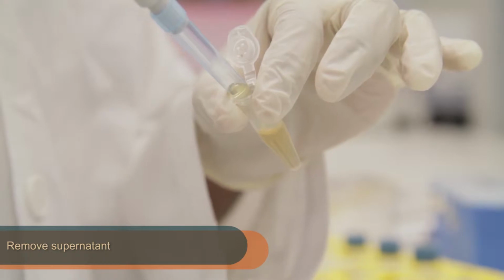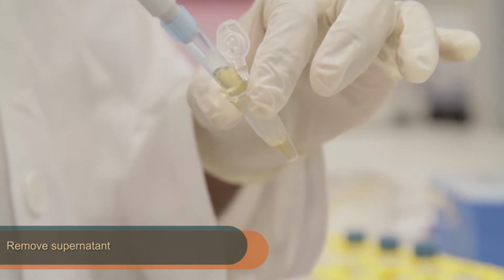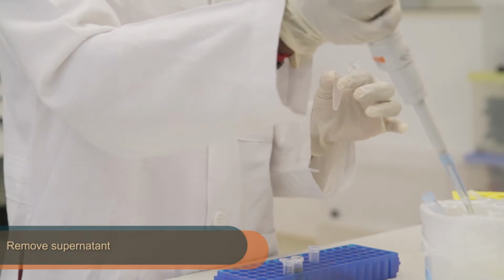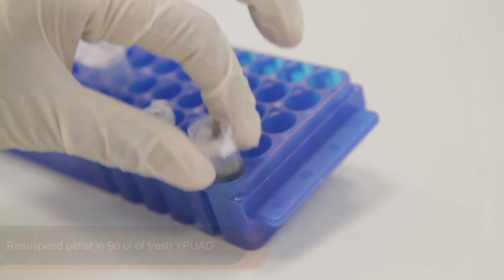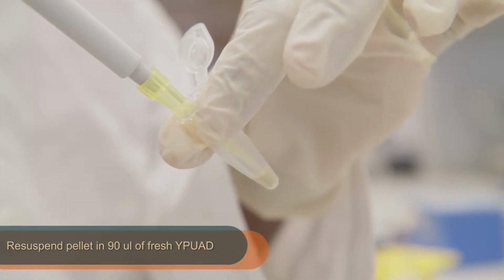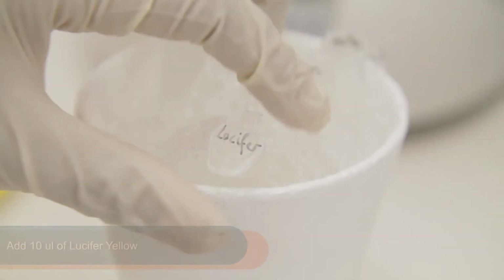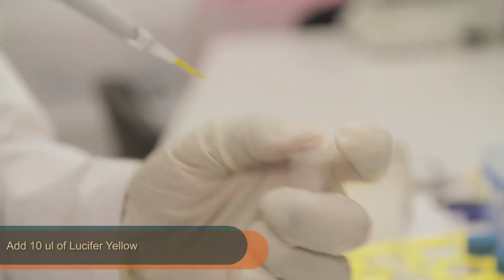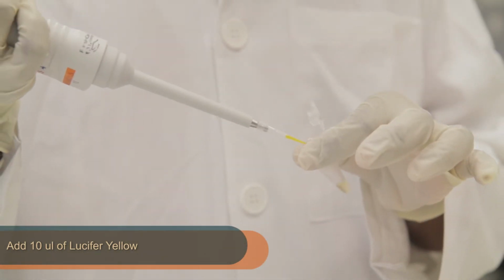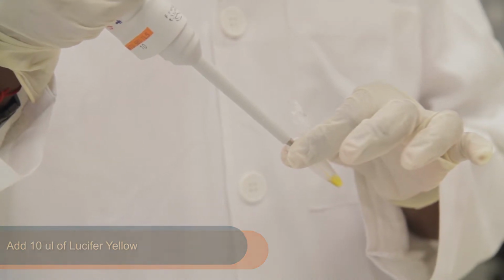Remove the supernatant from the tubes. Be careful to leave the cell pellet intact. Following this, resuspend the cell pellet in 90 microliters of fresh YPUAD. After resuspension, add 10 microliters of lucifer yellow dye. This will be aliquoted for you by the TAs.